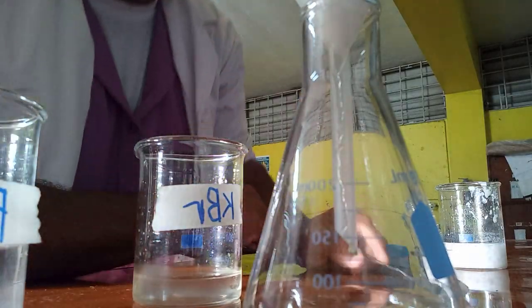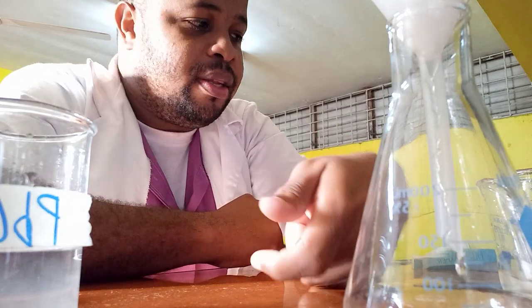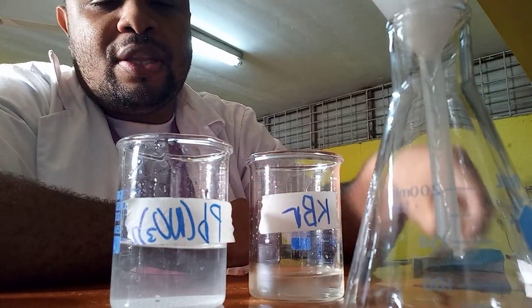Now I'm going to let you have a look at the filter funnel. That white solid you are looking at — that is the lead bromide. When you filter it, the potassium nitrate, which is soluble, comes into the conical flask, and the residue is the insoluble salt, which is lead bromide.